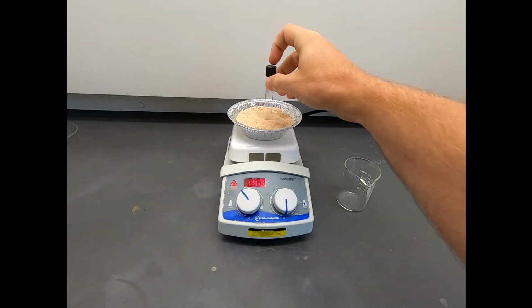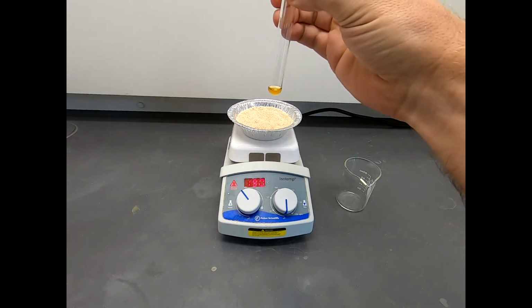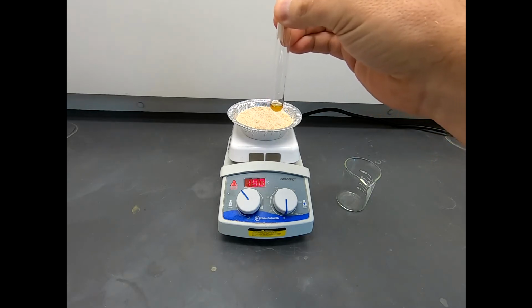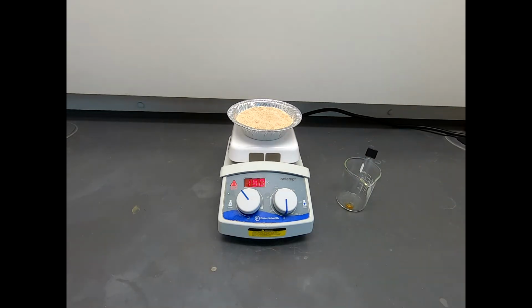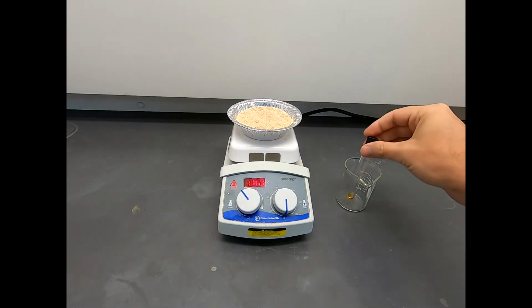We have now gone for the full 2 hours, and this is still melted and still generating vapor along the sides, but this reaction should be complete. So the Diels-Alder should be done. So I'm just going to take it off the heat, leave it on the bench top, and if this reaction goes the way my previous attempts at this reaction have gone, this will solidify as this cools, and then we'll take care of the solid that forms inside this test tube.